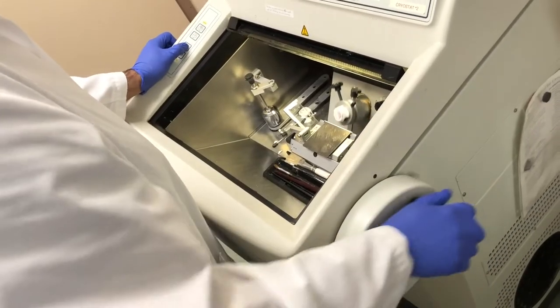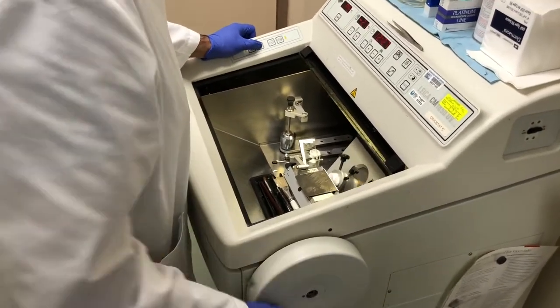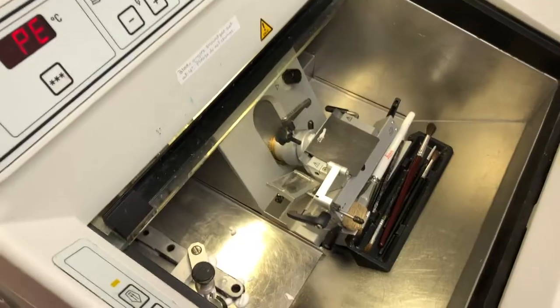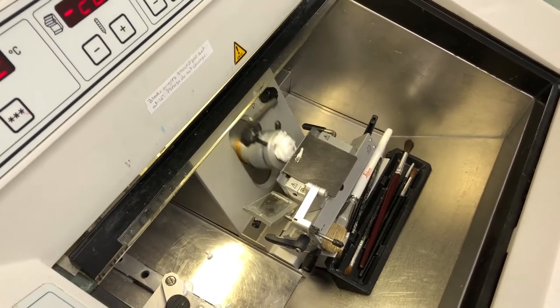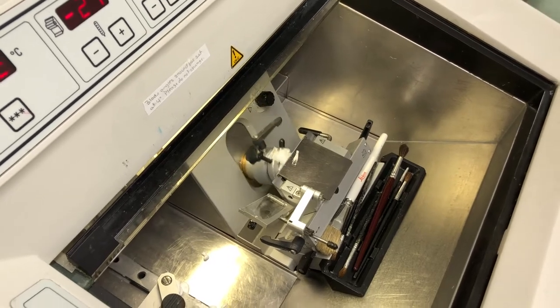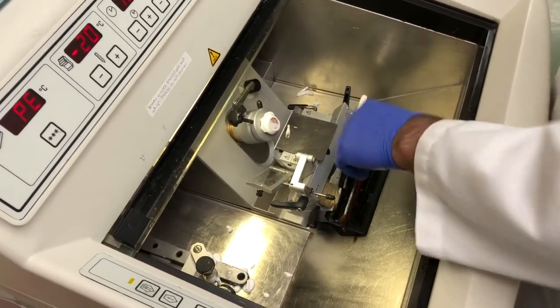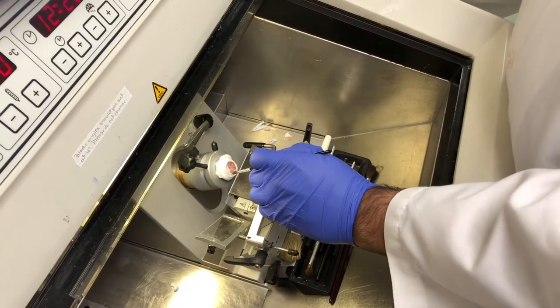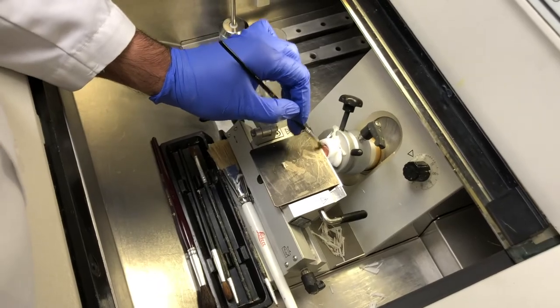Use one hand to begin spinning the wheel until you get nice thin slices. With the other hand, pull the slice back using a thin paint brush.